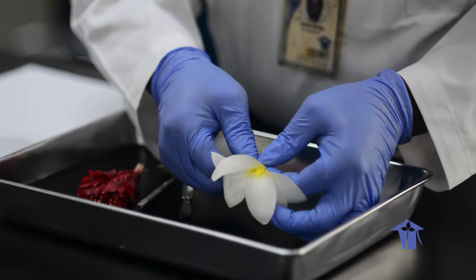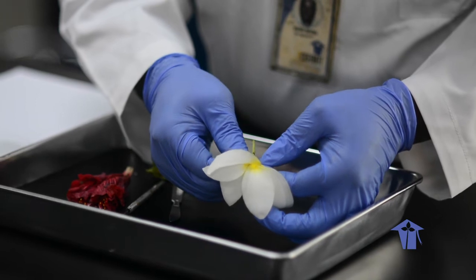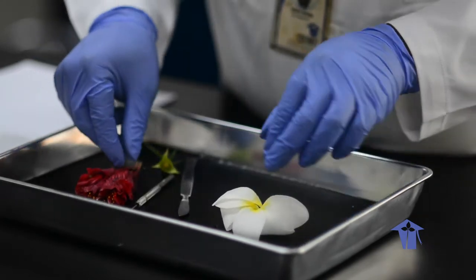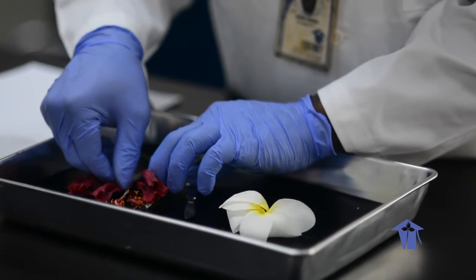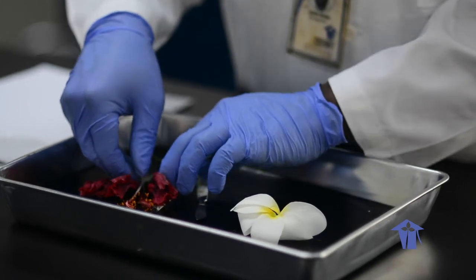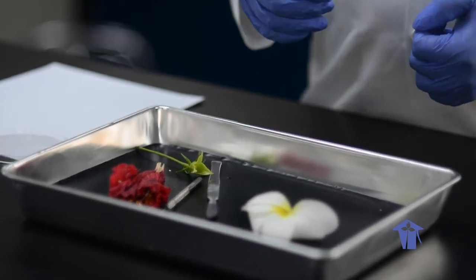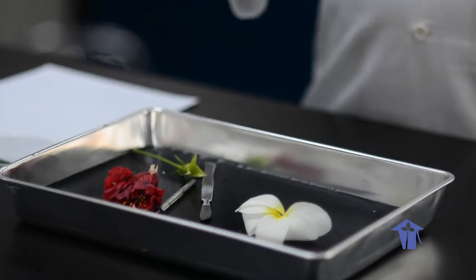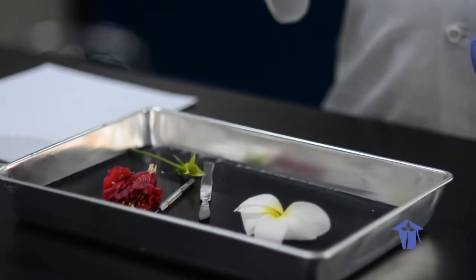Now, in terms of the anther and filament, even then we can't quite clearly see the stigma and style in this. Down here is where the ovary would be, but here within the hibiscus, the stigma and style are easy to differentiate, and the anther and filament are easy to differentiate as well. So ideally, we want to use the hibiscus for the dissection lab, and when doing the dissection, we want to use a light cut along the region stated by the lab manual, so that we get to see all of the intended structures.